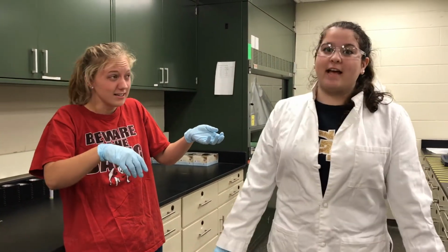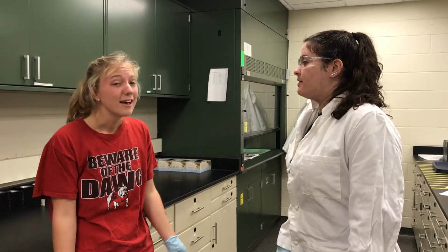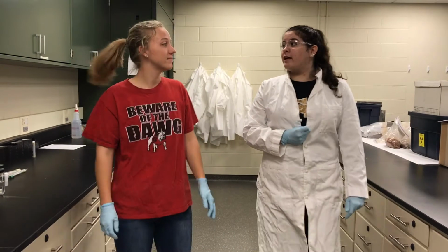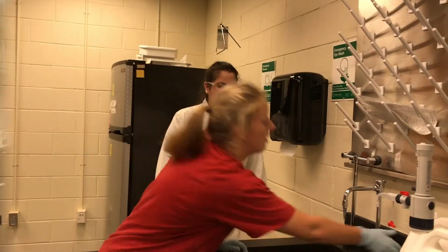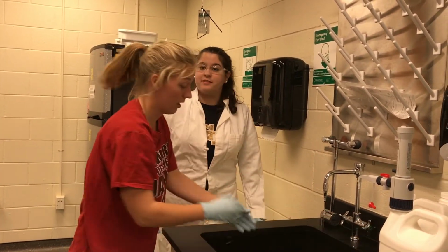Accidents happen, again, but as long as you know how to respond, everything's going to be fine. We need to wash your eyes out for 15 minutes. 15? Again? 15 again. Come on, let's go to the eye wash. You know, if you're wearing lab goggles, this wouldn't have happened. No, not the sink, the eye wash. Oh! And don't forget to take off your gloves.